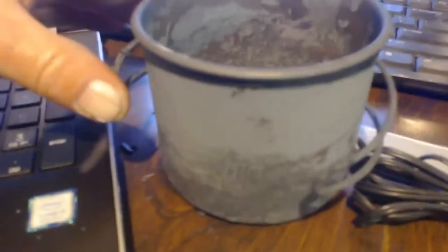I don't know. If anyone knows, let me know, because maybe I'll sand this down or something and put it back in. Maybe, I don't know. And you can see I left some calcium oxide in there. But you can see all the sides and that it's just flaked off, man. Stuff just all that fell into my calcium oxide and ruined it. And I can't think of how to get it out of there. Oh, maybe a magnet. I'll try a magnet, but if that don't work, I mean, I can't put it into water because the calcium oxide will turn into calcium hydroxide.